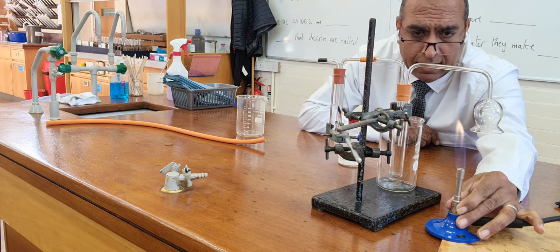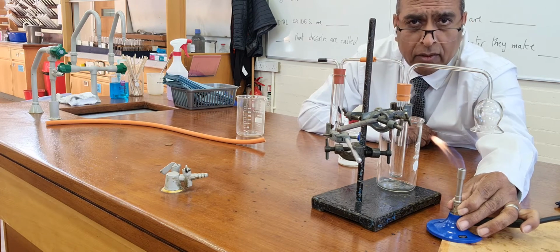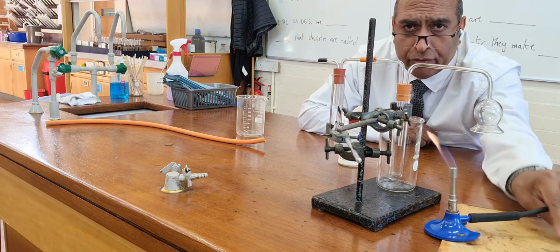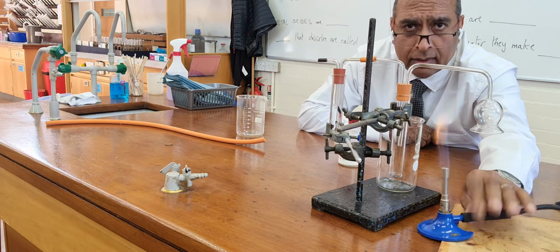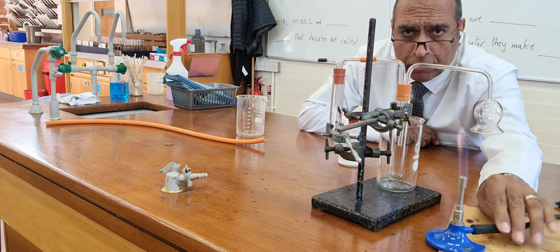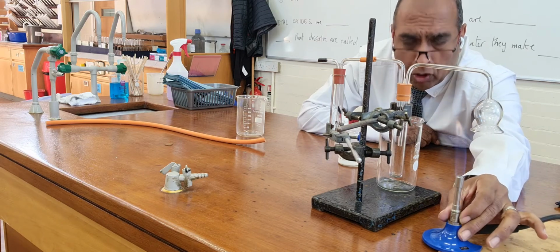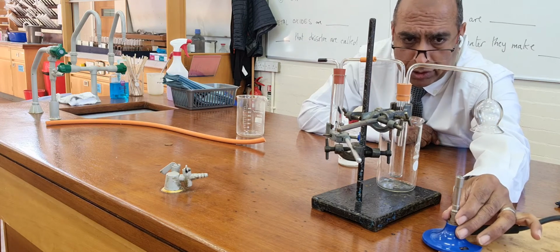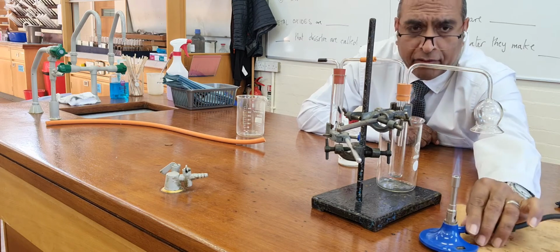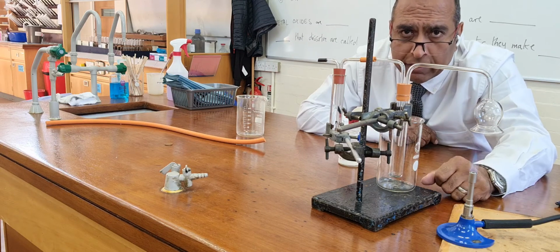And really what I want to focus on is the products of combustion. We know we've got methane coming through this black gas hose, CH4. So CH4 comes down this black tube from the gas tap, and the gas goes up here and burns. Now if I open the air hole and get more oxygen, then I get this roaring flame. The roaring flame has only got carbon dioxide and water coming off it.